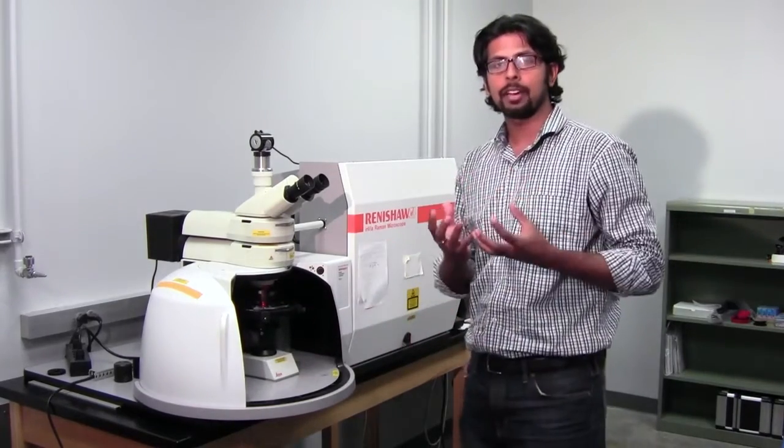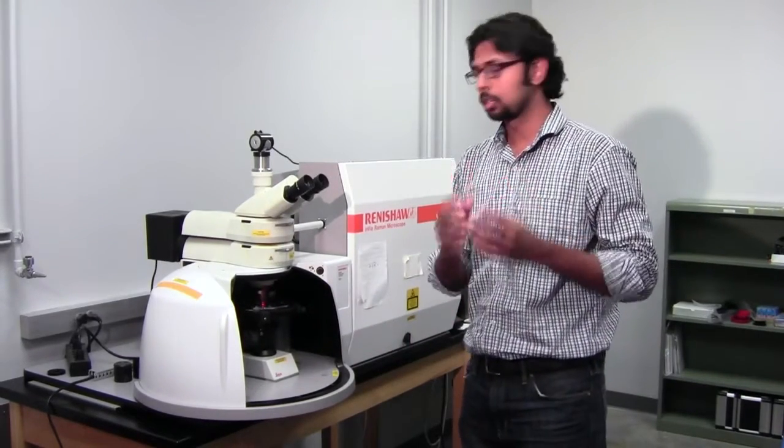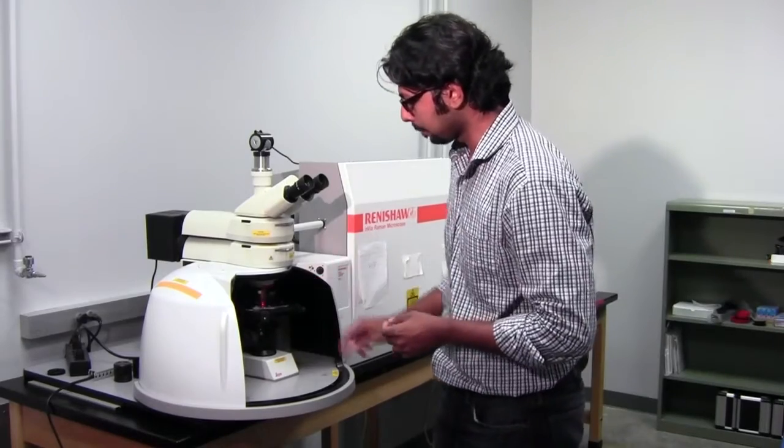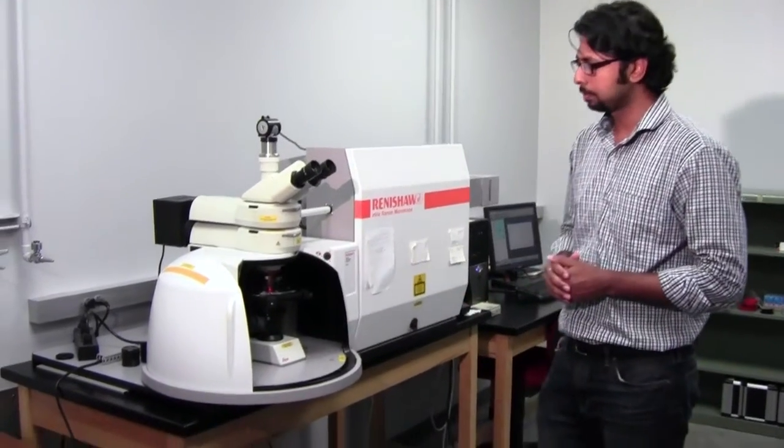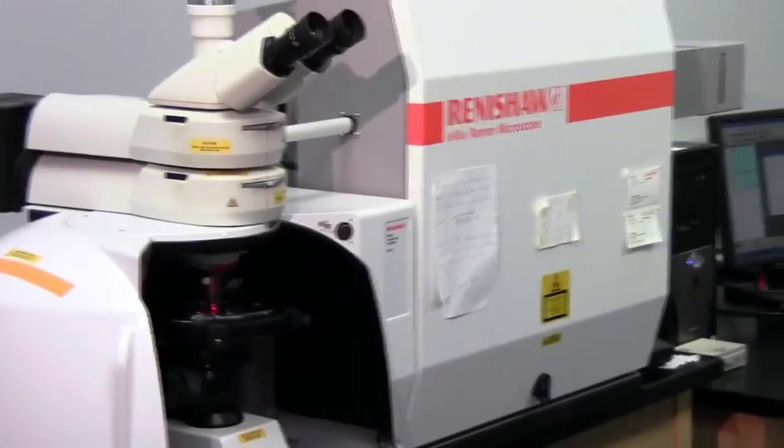As you know, a microscope can magnify images and help you focus on a particular spot. So what you do after placing a sample is focus with the microscope. As you can see, the microscope objective is somewhere there.